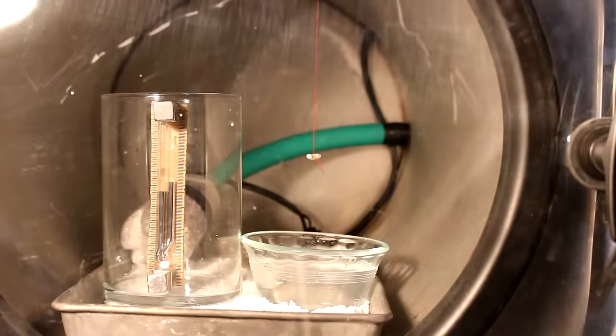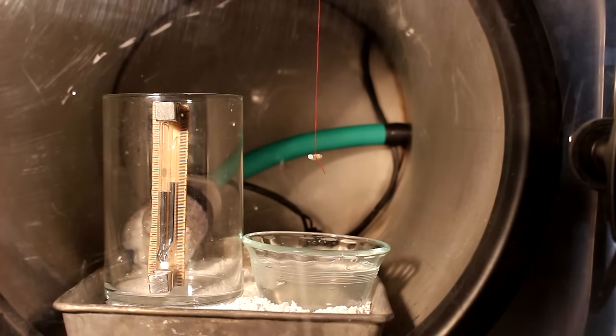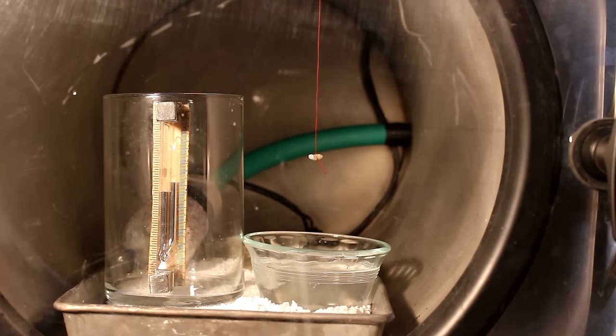It looks like the pressure is five, six, seven millimeters of mercury. Alright, let's cut this string with my laser and drop the potassium into the water.